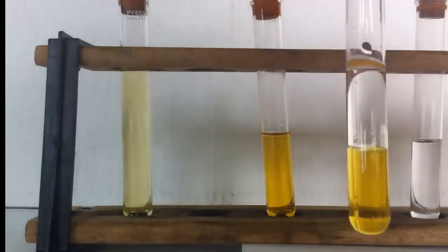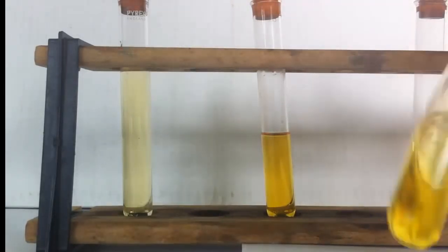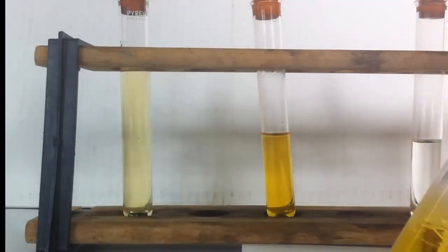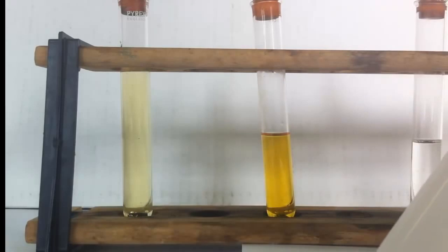What I'm now going to do is shake the liquids through one another. And watch what happens. And there you see the result. The bromine water has been decolorized.